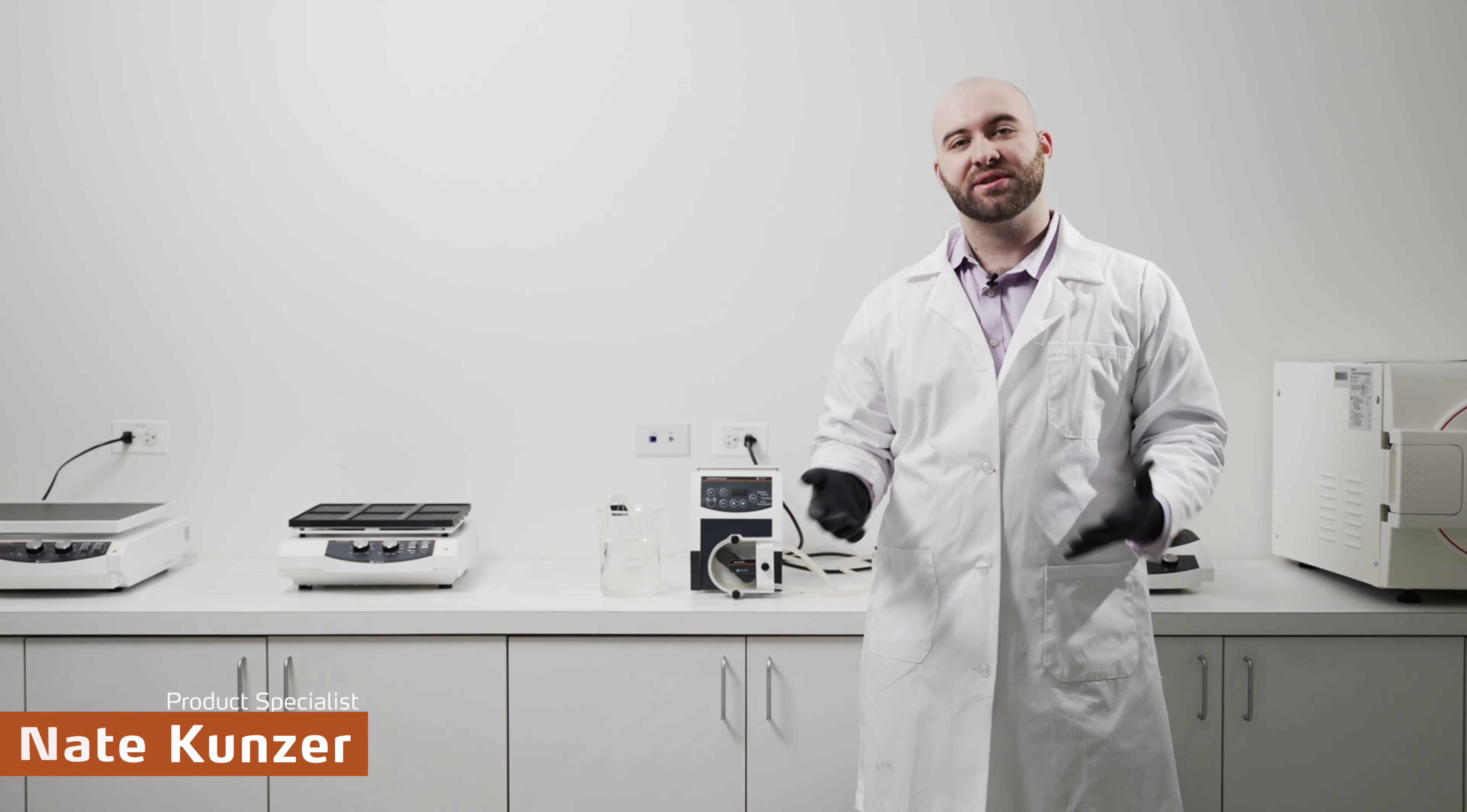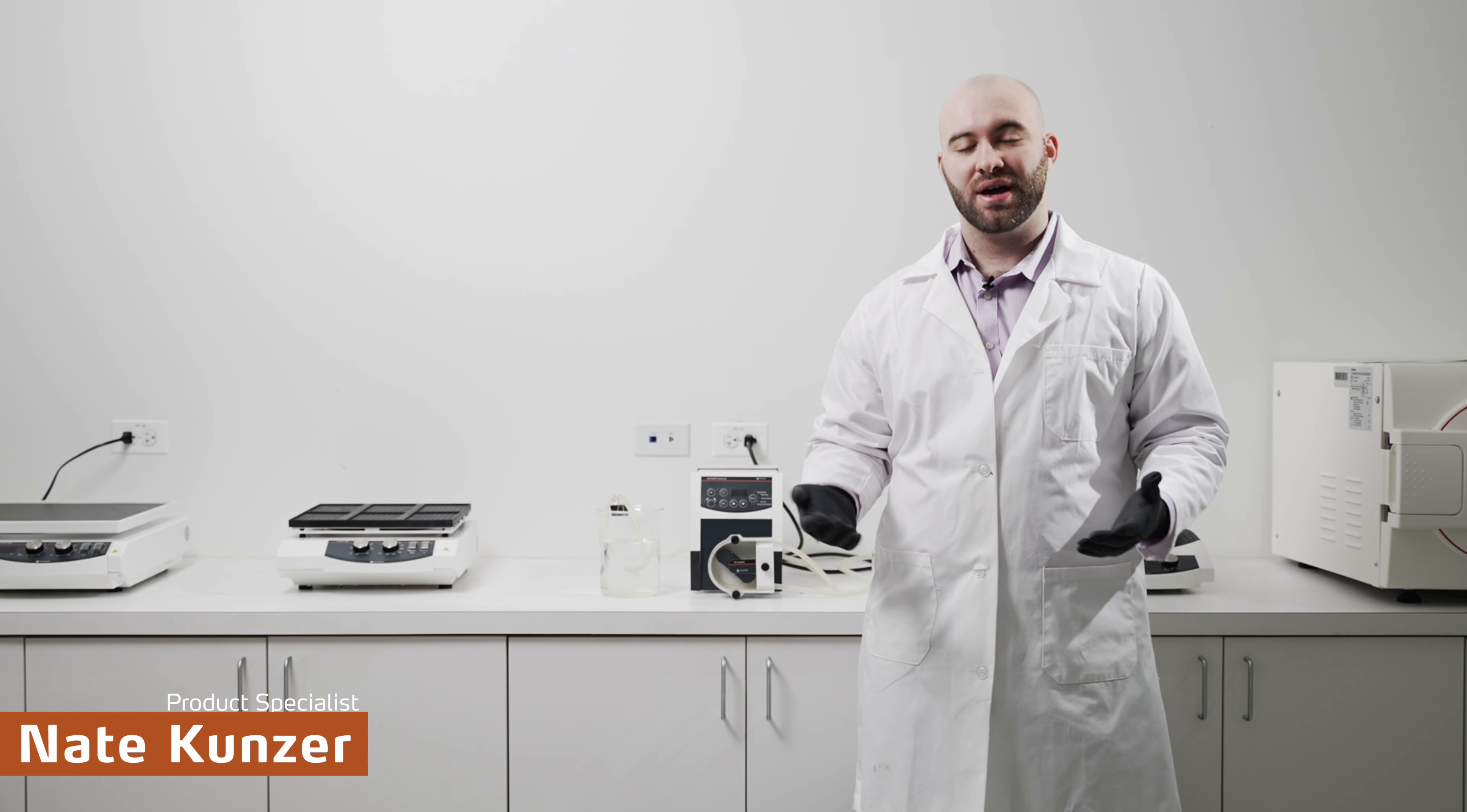That was calibrating the peristaltic pump. Again, I am Nate Kunzer, product specialist from Heidolph North America. Thank you again for watching.